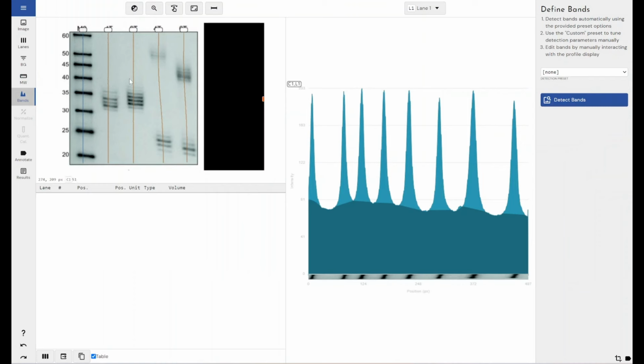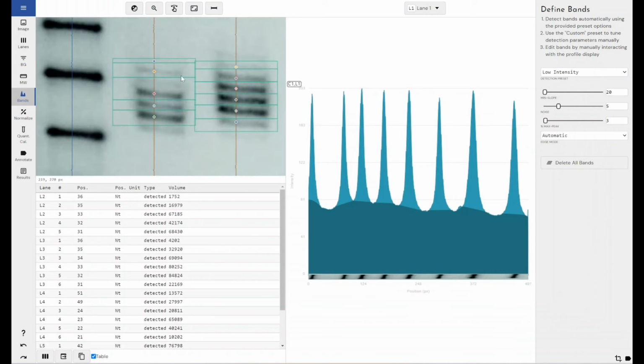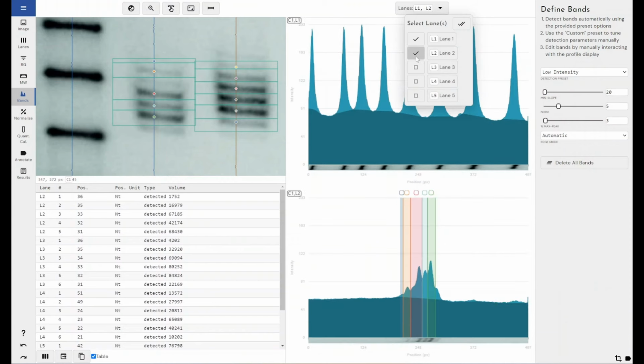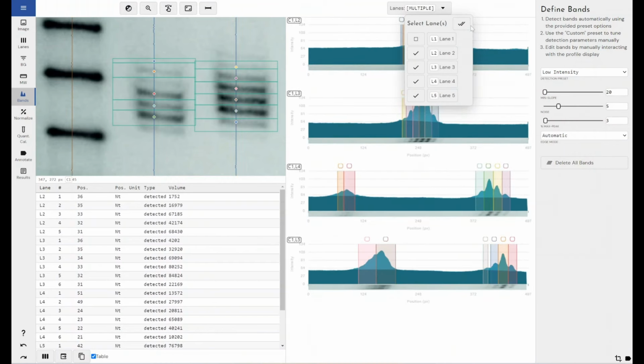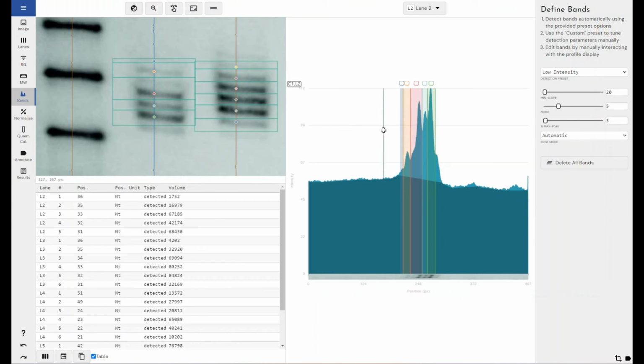So if I come through to my band section now, I'm just going to go for a low intensity default preset. So as you can see, it's picked up some bands, but it's not picked up all of my bands, and it's merged some bands together. But that's easy to correct within the software. So I'll just do this one lane at a time. So if I just show my secondary lane here, I want to probably extend that across there. I want to split this band, right click, split. And then I've got my 3 bands there, and then I've got another band here. So I can just left click and drag to add a new band.